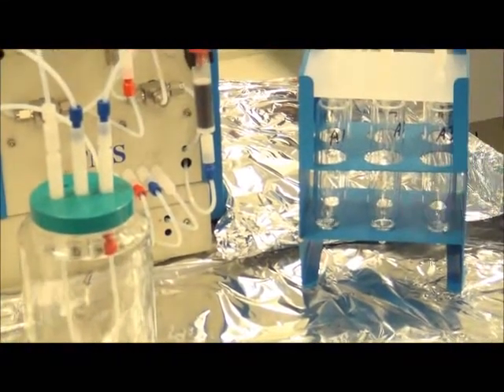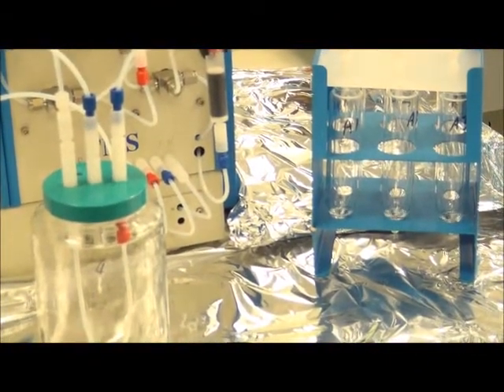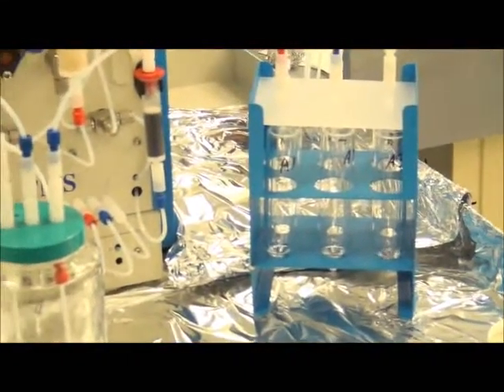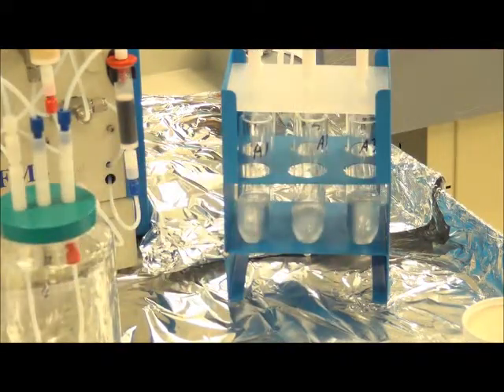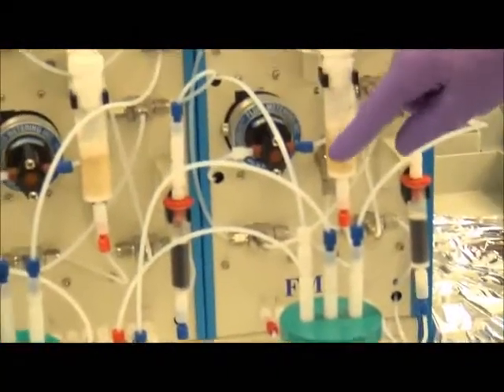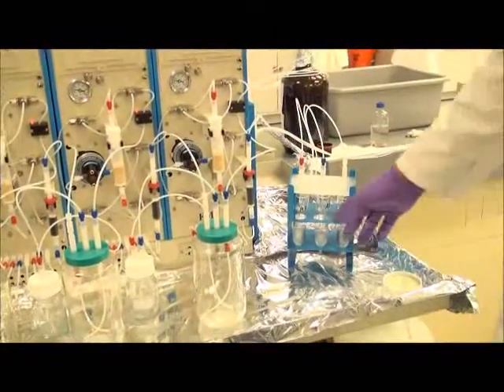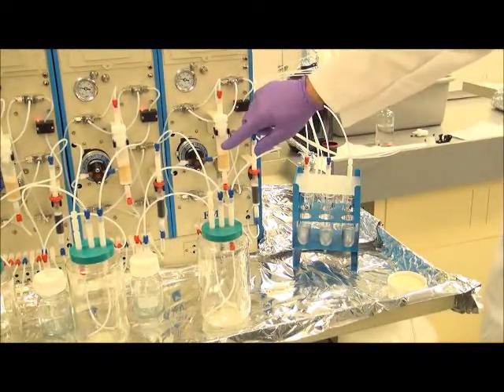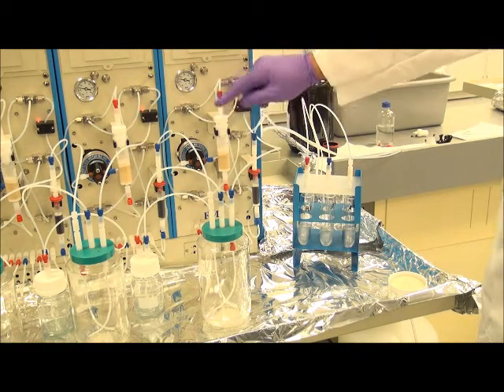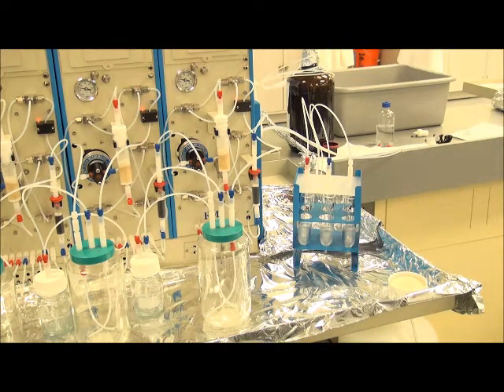Whereas fraction one solvent is being collected in the acid fraction vial. After all the sample rinse is drawn up, it'll then follow up with an additional rinse of methylene chloride across the mixed bed cartridge to ensure that no analytes are left behind from the bottle rinse. And that again will be collected in the acid vials. At the end of the cartridge elution, there will be a brief nitrogen push to push all the remaining fraction solvent to the acid vial before we begin re-exchanging the cartridges for the elution of the basic compounds.